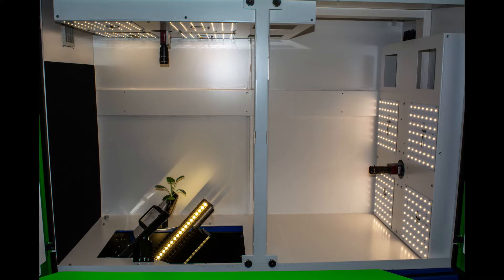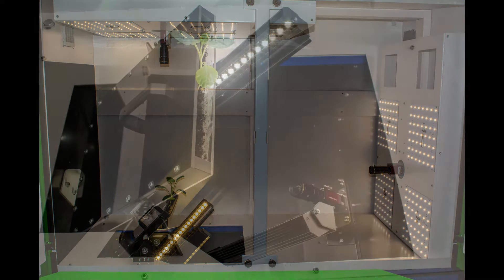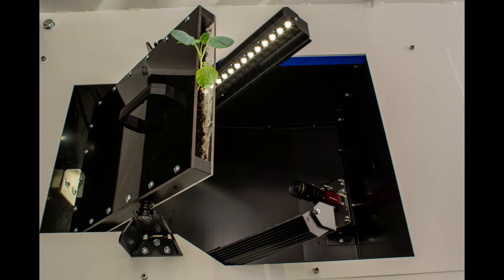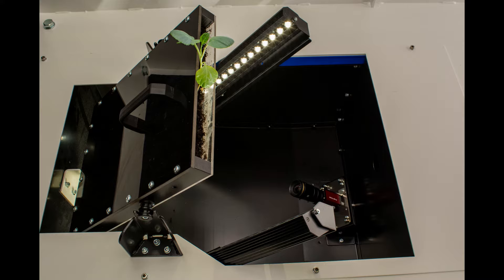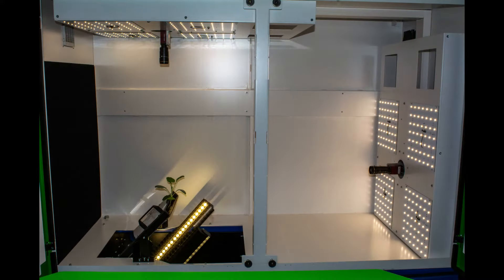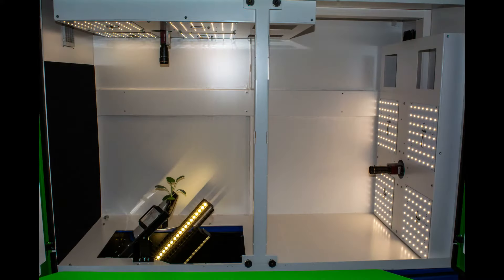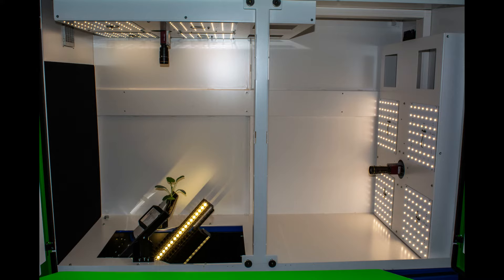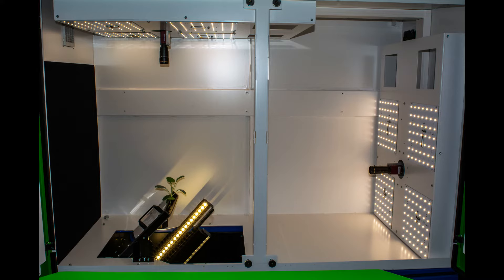It has three cameras. One camera looks at the transparent plate of the Rhizotron to view the roots. The second camera looks horizontally at the shoot emerging from the Rhizotron. The third camera looks top-down at the shoot of the plant.